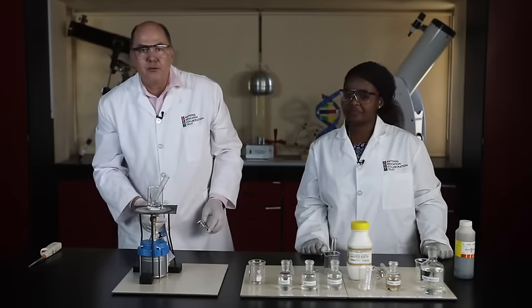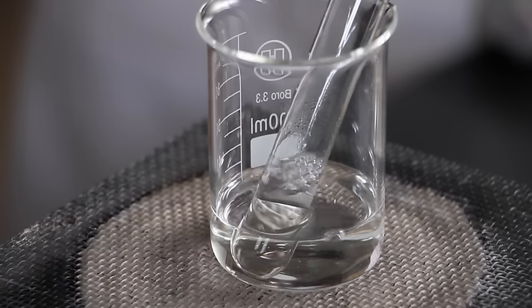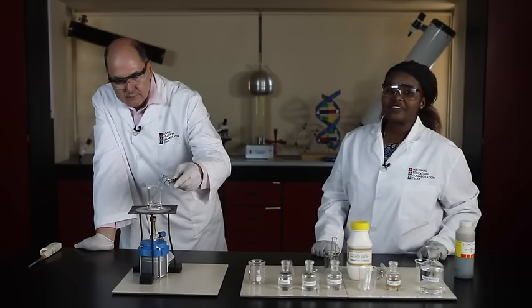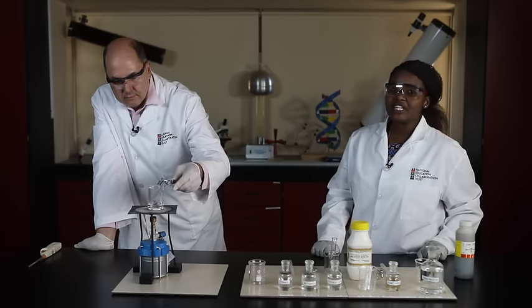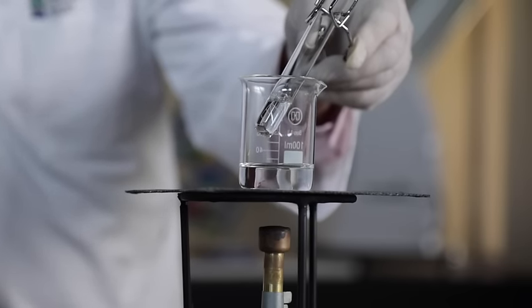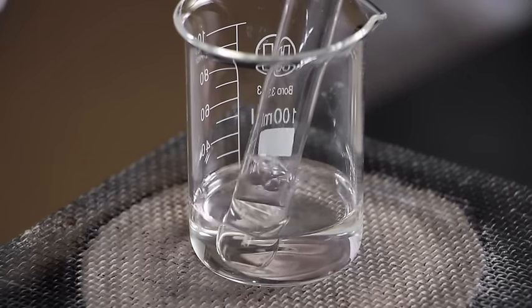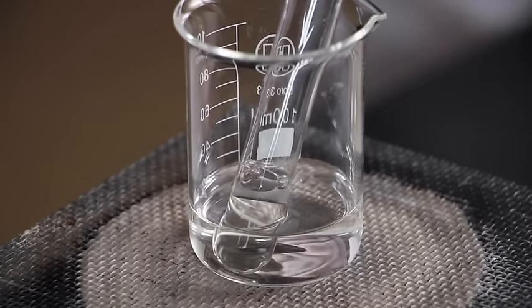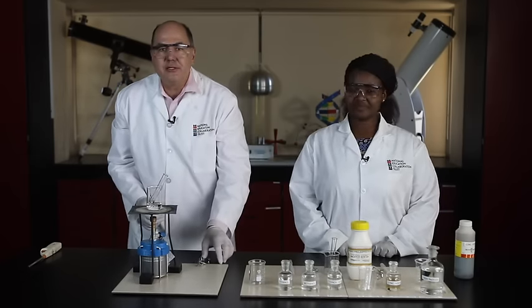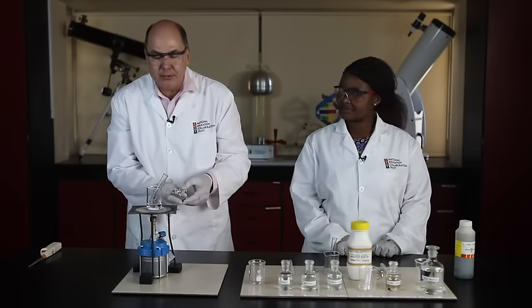I'm going to let it cool down for a minute while it stands on the gauze mat here. The reaction is going quite nicely. Be very careful at this stage. If the contents of the test tube starts to boil, take the test tube out of the hot water and let it cool down slightly before returning it to the hot water. After about a minute in the hot water, we take the test tube out of the hot water and put it into an empty beaker to cool down.